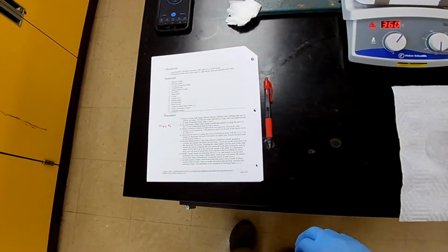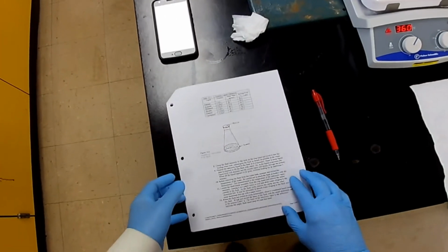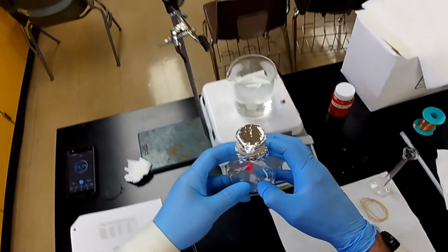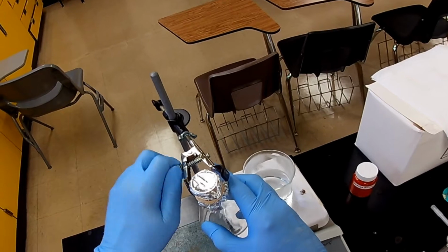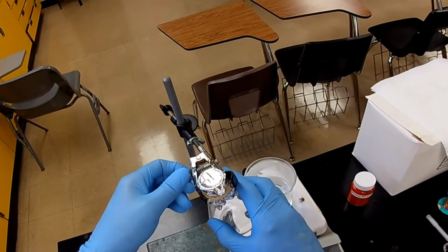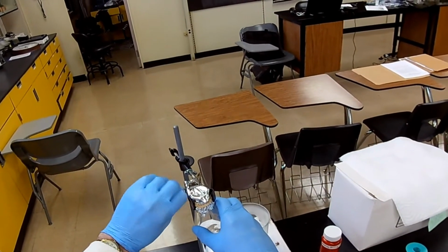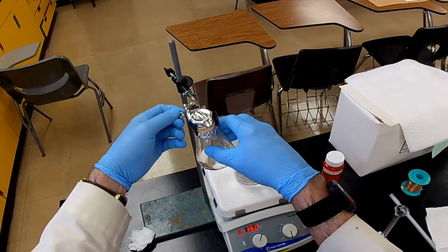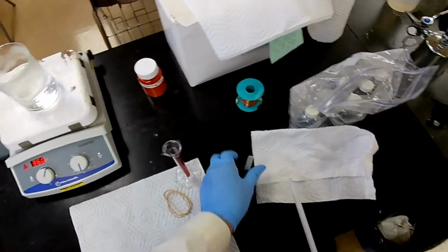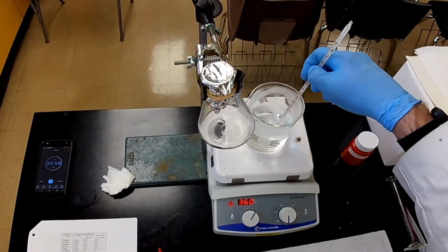All right. So now, we've punched the hole in it, and we're ready to clamp it and submerge it in the water bath. So let's go back like that. Let's clamp it down like this. Let's see, let me back up so you can see a little better, I hope. We don't want it popping up. Now, before we submerge it, let's check the temperature. It appears to be boiling, so let's see what the temperature is.